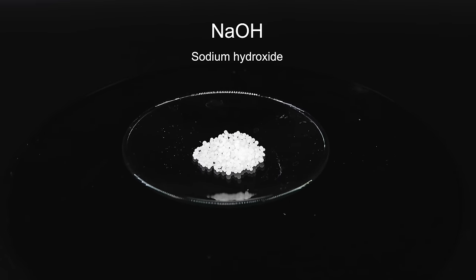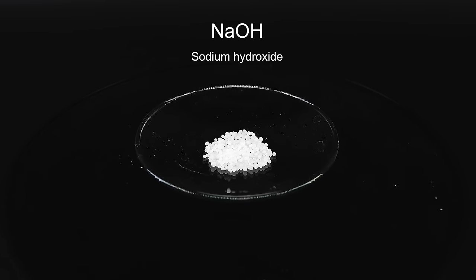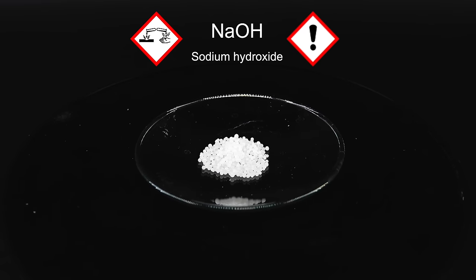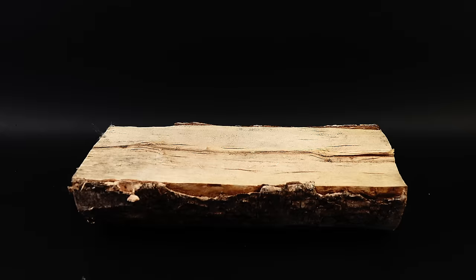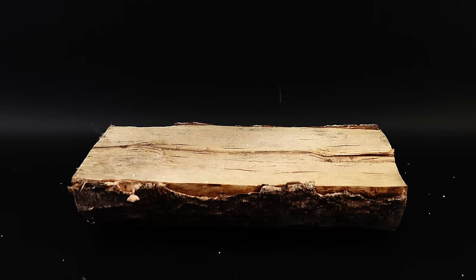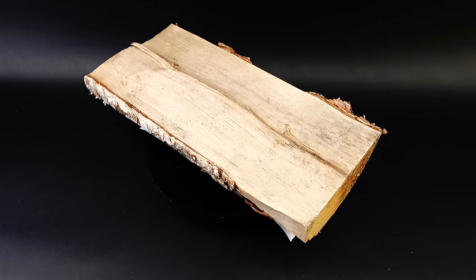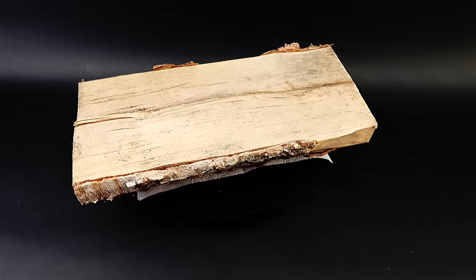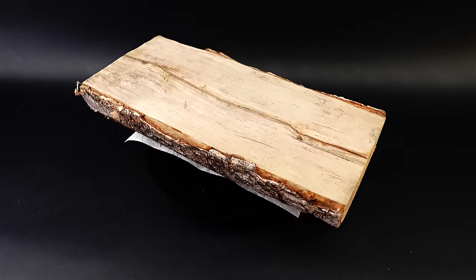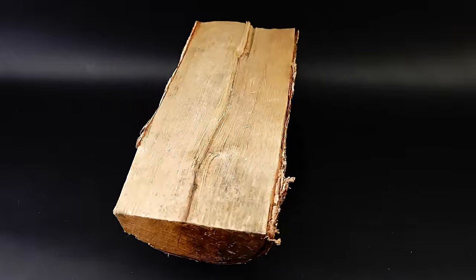Sodium hydroxide is a really widely used reagent, and can be found in almost every household as a drain cleaner. It's really corrosive, and has just the right amount of chemical brutality to break apart lignin, but leave the cellulose untouched. I can't just sprinkle some of it onto my log and expect it to do anything — I first have to make it into a solution that will then leach into my wood. In the form of this quite averagely sized piece, it's still way too thick for the sodium hydroxide solution to soak into it, so before giving it the buff of a lifetime, I need to break it up into smaller pieces.